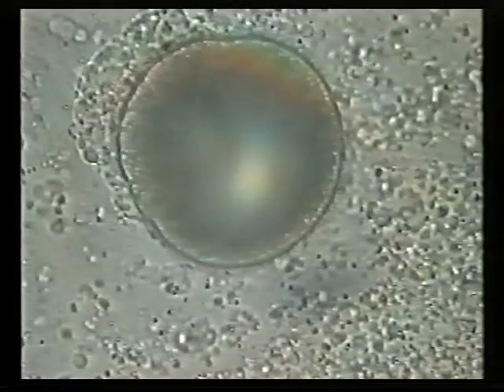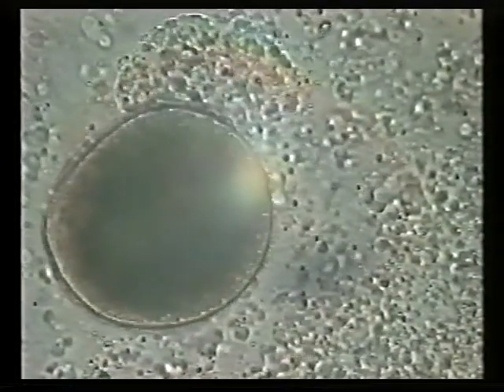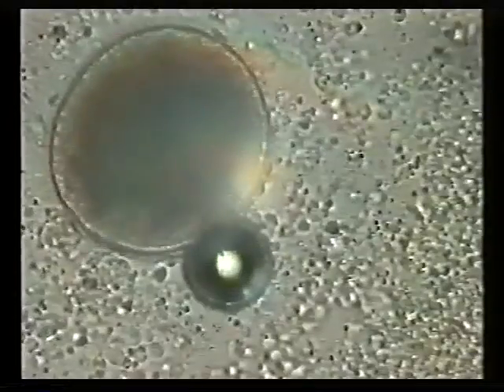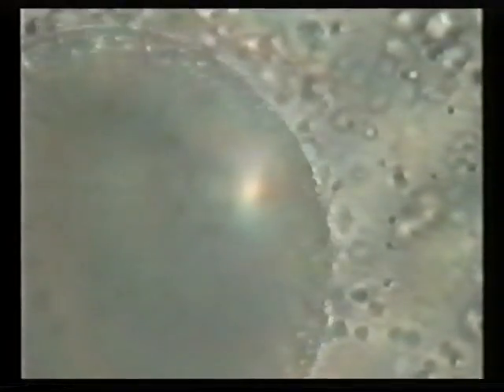During their latent stage, they cannot be affected by chemicals. Most white spot, viewed under a microscope, will not show the typical horseshoe shape usually illustrated in books, as it is usually juveniles you see first. In this rare view, you can actually see the white outline of the horseshoe. A magnification of 200 times is best for identification, especially when viewing juvenile stages.